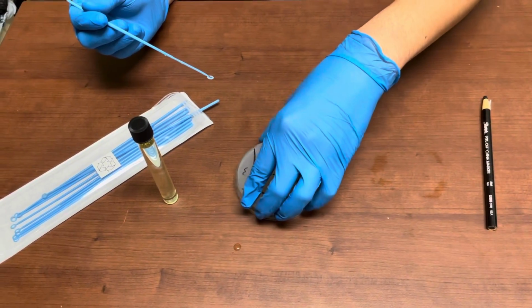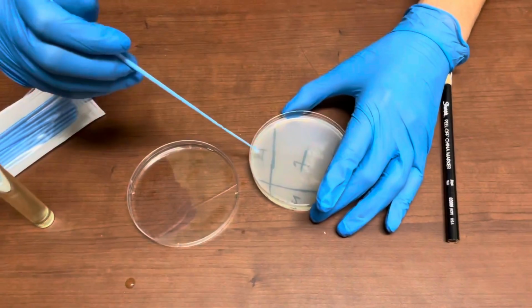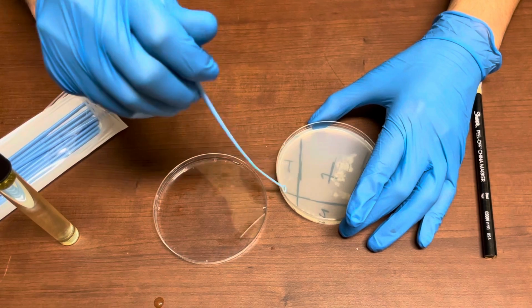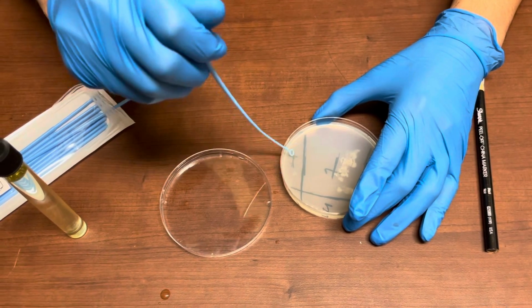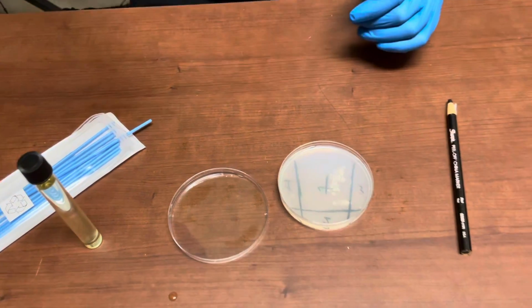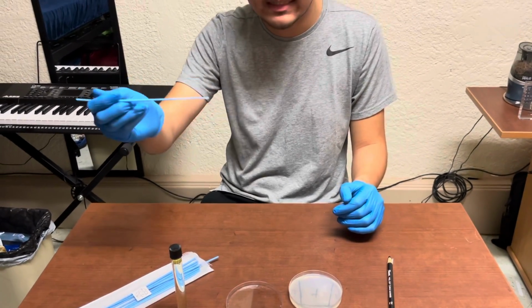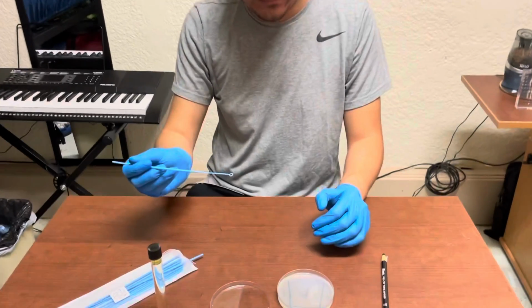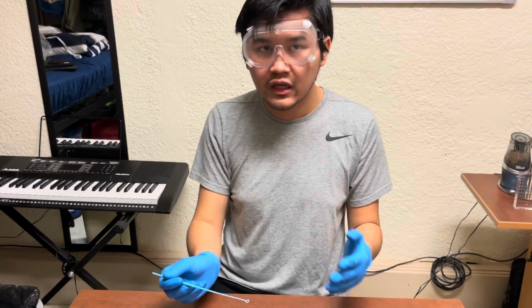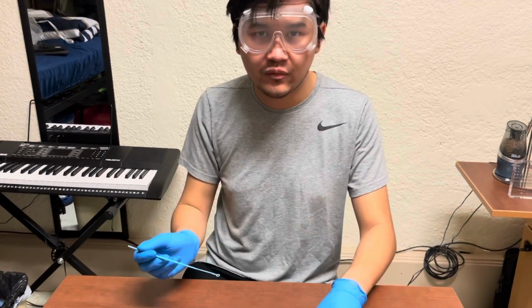So now we're going to take our agar plate. I'm going to turn it over and cover it like so, and I'm going to start in quadrant 1, going in diagonal strokes like so. Now, the technique that you'll be using for streaking for isolation, you'll not want to go too vertical, so as to tear the agar, or too flat, as to not actually spread any bacteria evenly. You want to do just right. And furthermore, don't tear the agar.